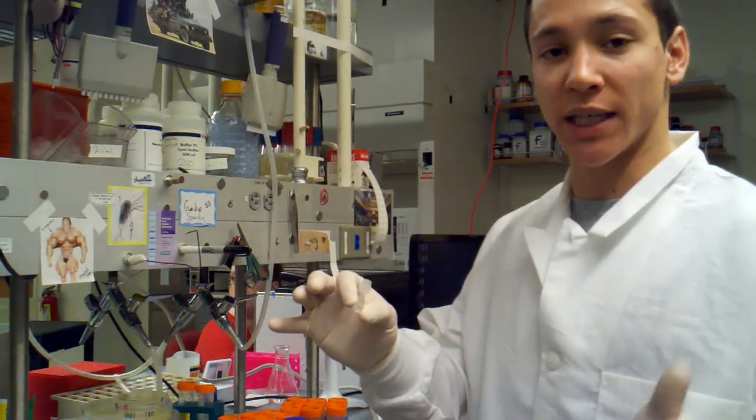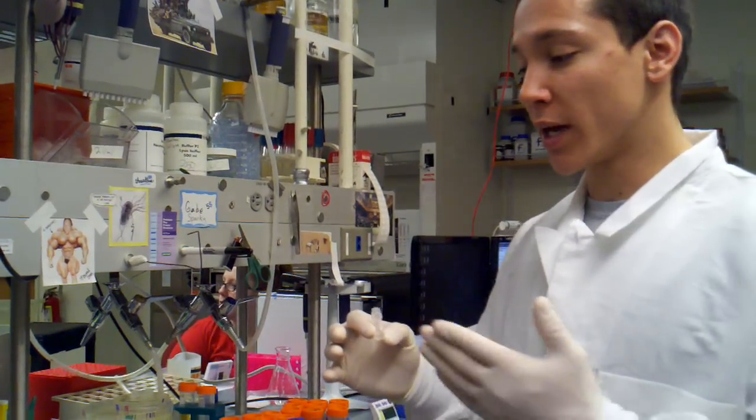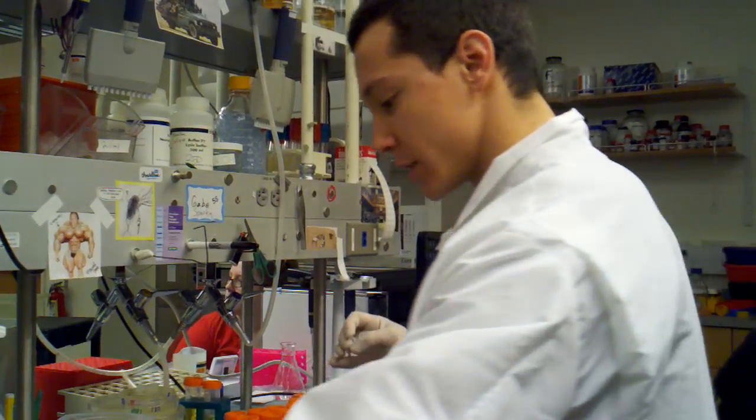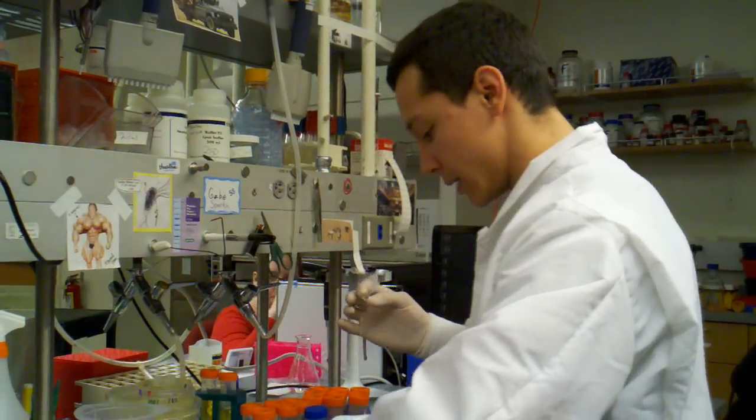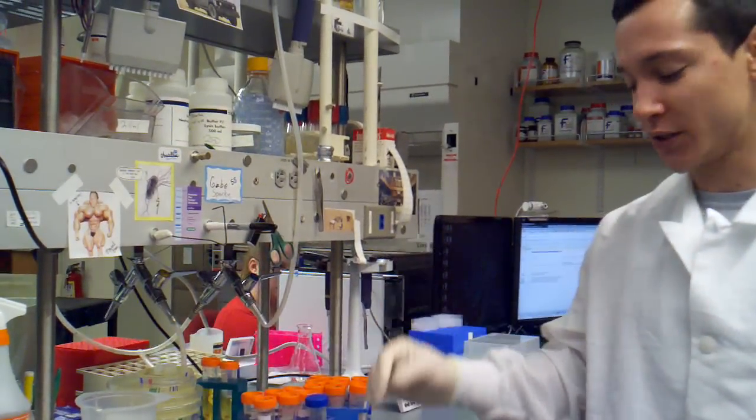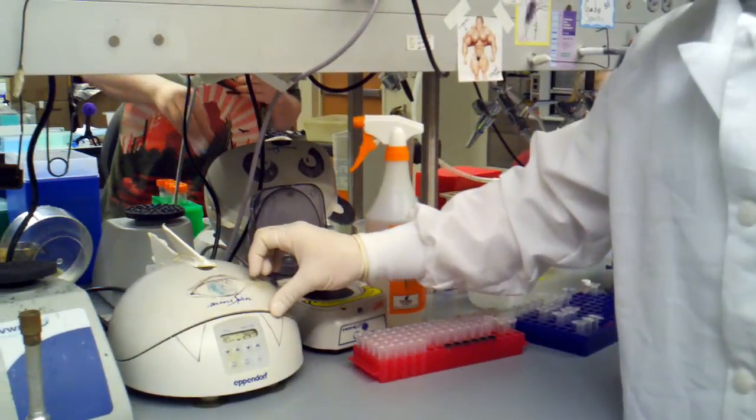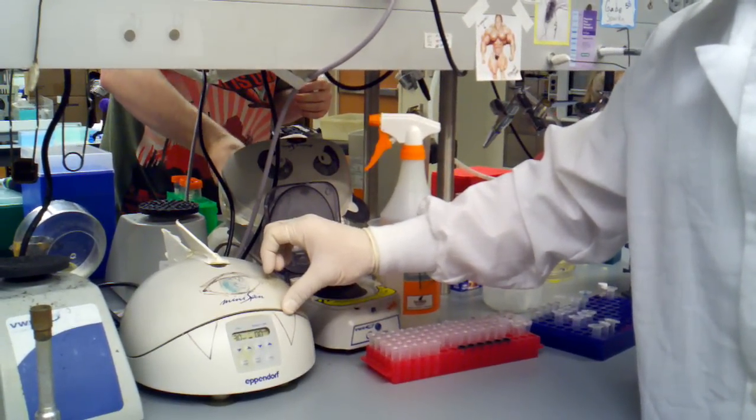Once it captures that membrane, we're going to do a series of washes that are going to get rid of sugars and salts and really clean up the DNA that we have there. So when we elute with water, we're going to end up with a nice clean sample. I'm actually going to set this aside because once you touch something, you don't want to put it back into your stock.